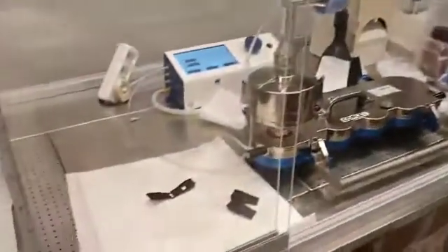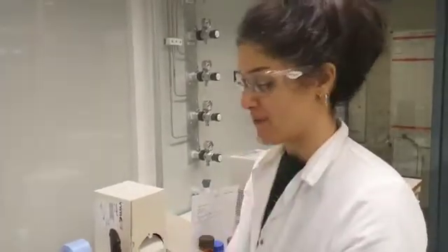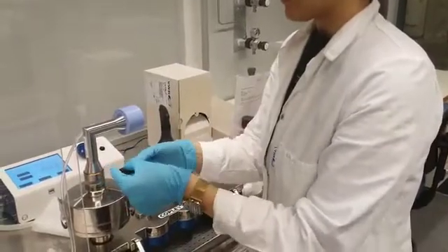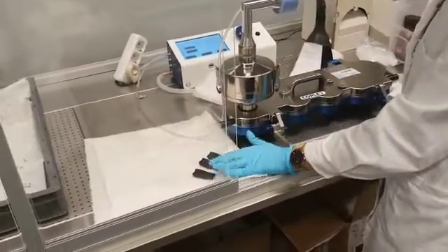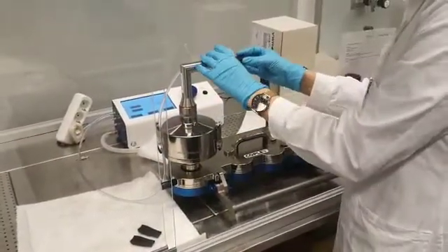Here we can see the silica particles inside some kind of vial. Good to mention that this is a demo — we don't have any API inside the silica particles, so these are unloaded silica. The particles are empty, no drugs inside, and because of that we don't have any masks — otherwise we would need to put a proper mask. This is the inhaler that we're going to use; it's going to be filled with a loaded silica particle, and then we can close it. We usually run three inhalers for one measurement. This is the system — it includes some cups inside. This is the inlet, and this is the pre-separator.